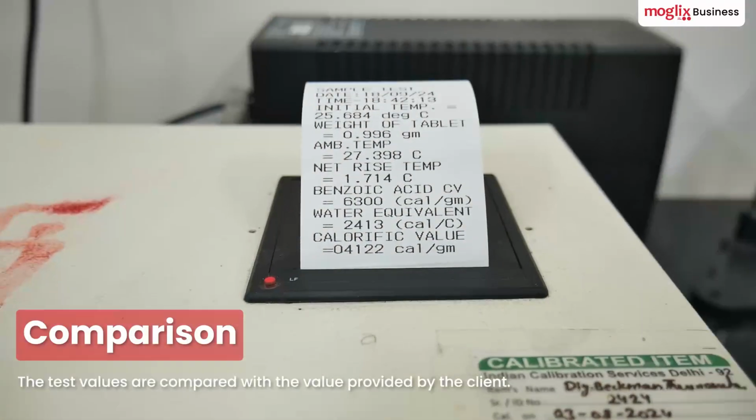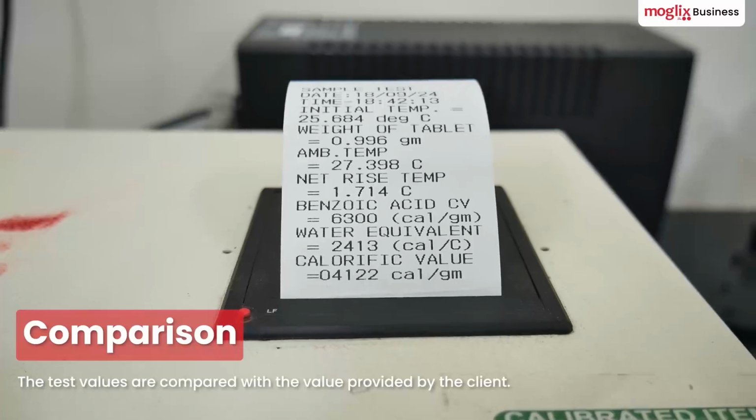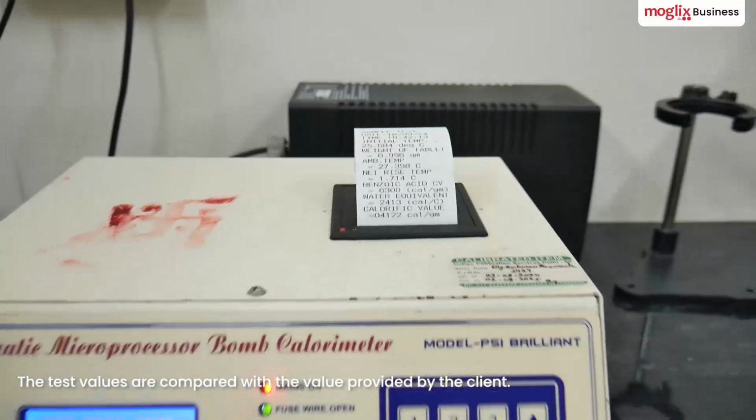The test values are compared with the value provided by the client. The closer the values are, the better it is.